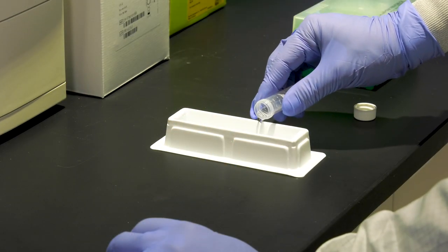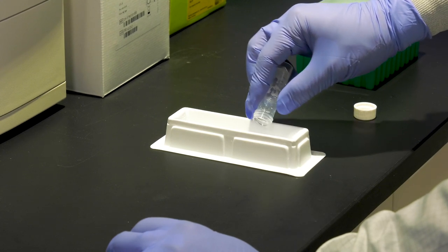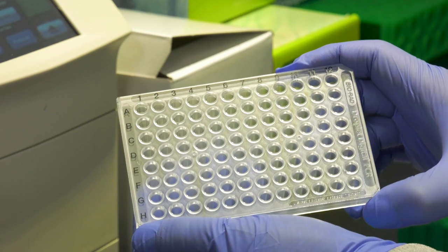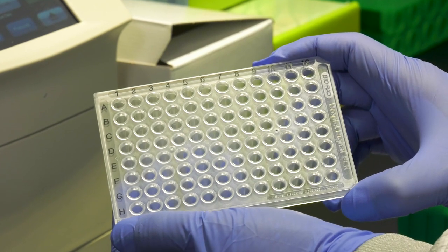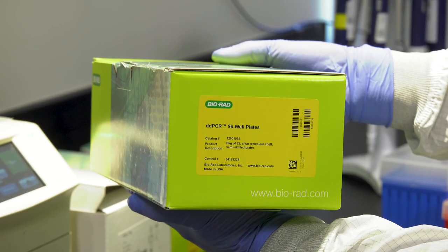Next, add the reaction mix to a reagent dispensing trough and dispense it into the DD-PCR 96 well plate, which is specifically designed for DD-PCR.